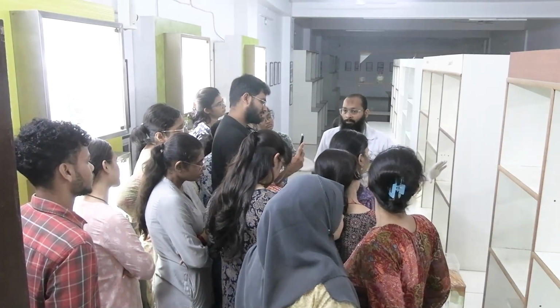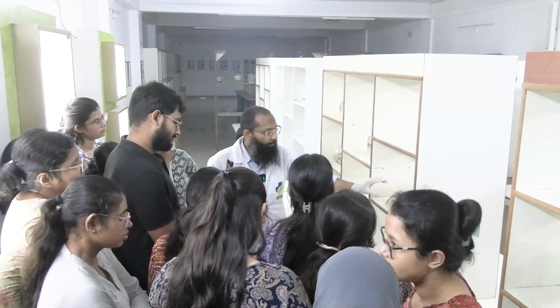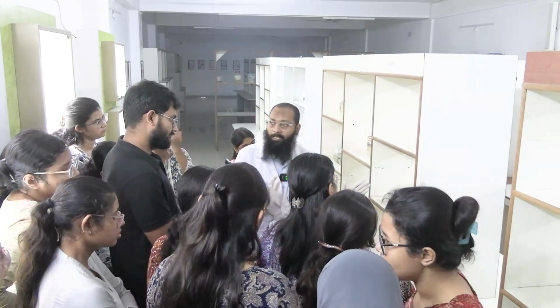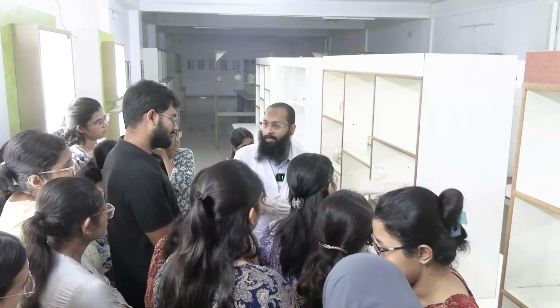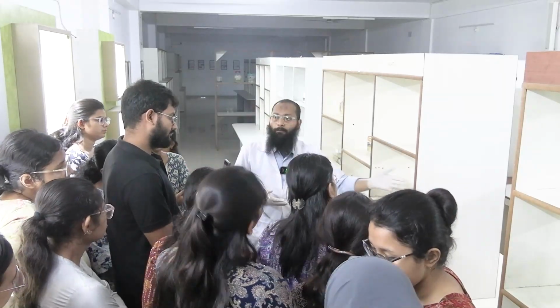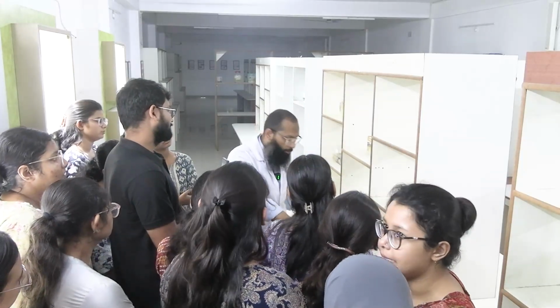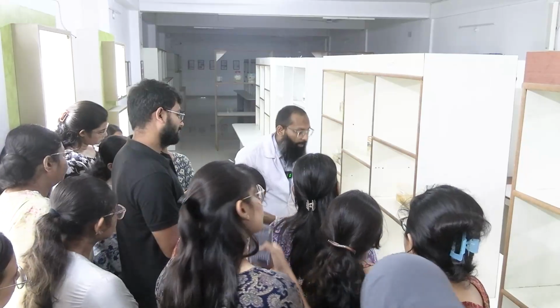For measuring, you can give an approximate measure, though it is not totally possible to give the measurement in a specimen in this form. How do we give the measurement? We put the specimen on the table, expose the whole tumor area, and take a scale and measure.